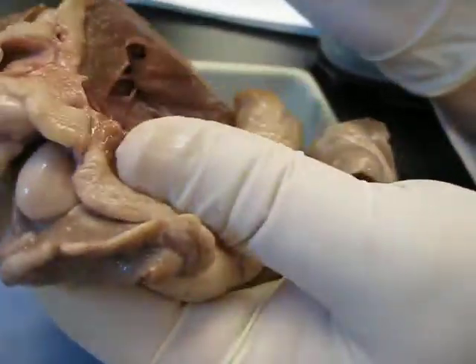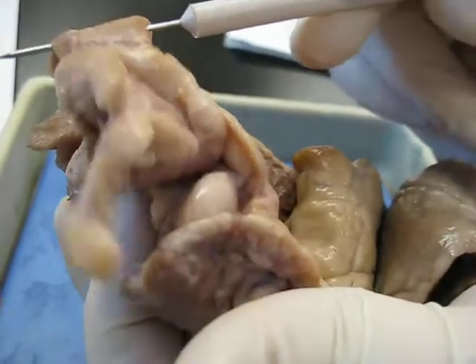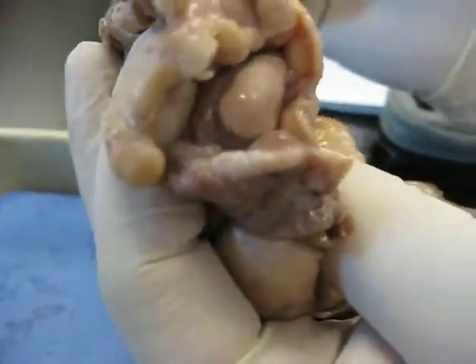Okay, now what about this one here? What's this one in front of it? A big one, almost as big as the aorta. Part of the pulmonary trunk. And if you look at the angle, it's going to be coming down into the right ventricle, exactly.